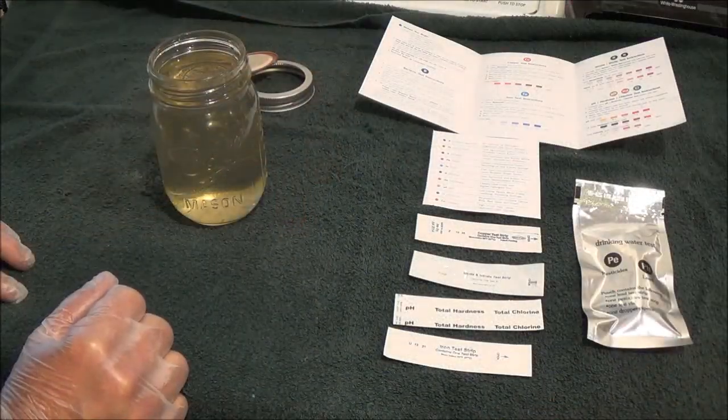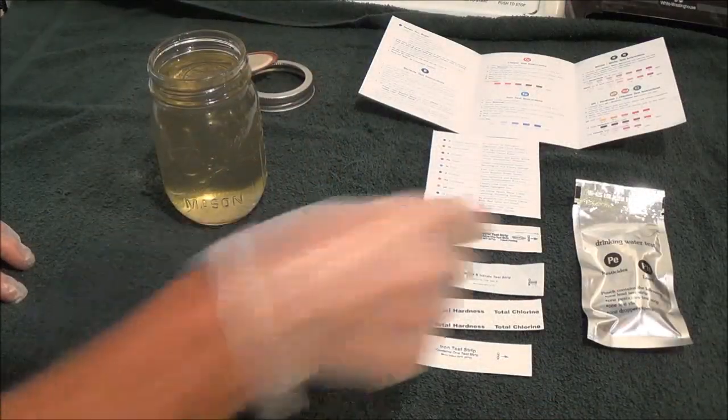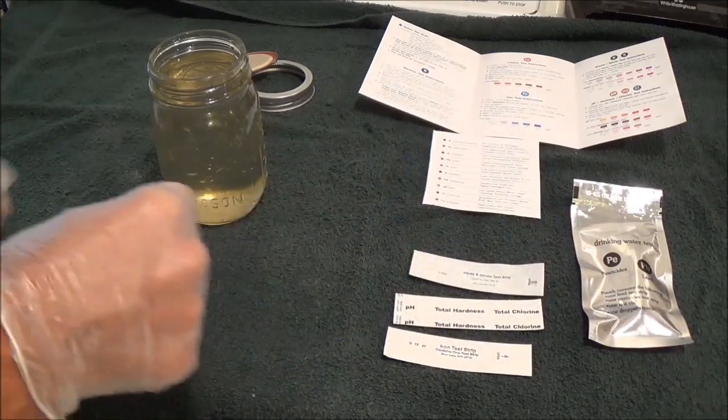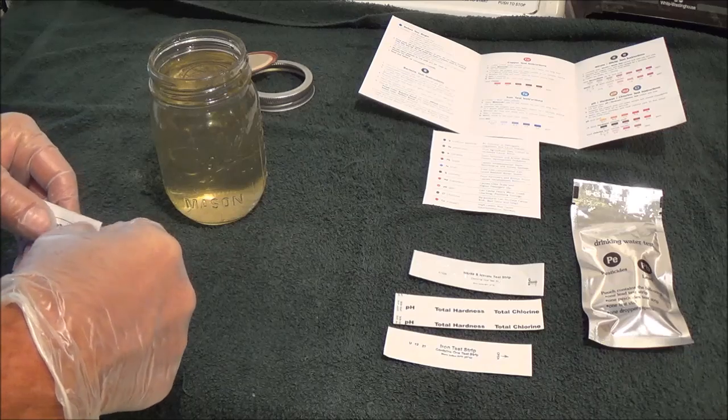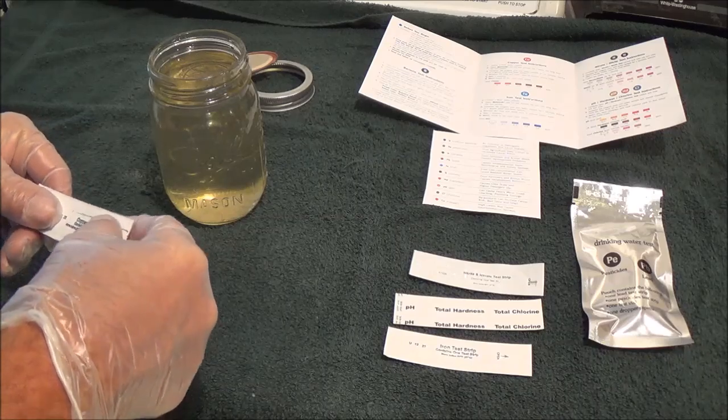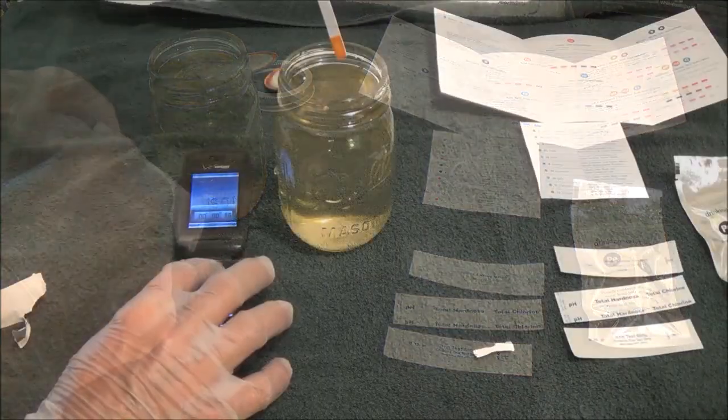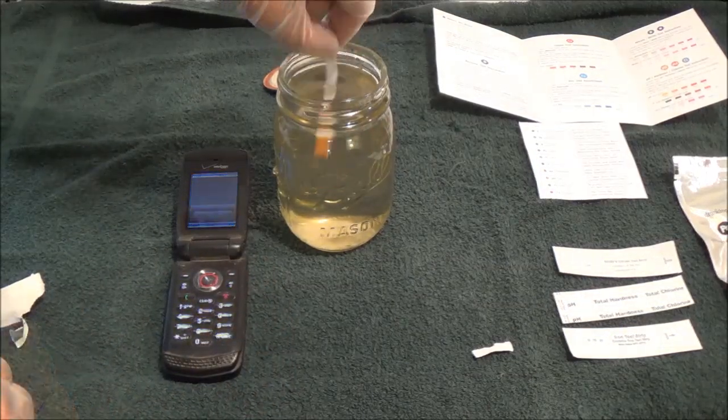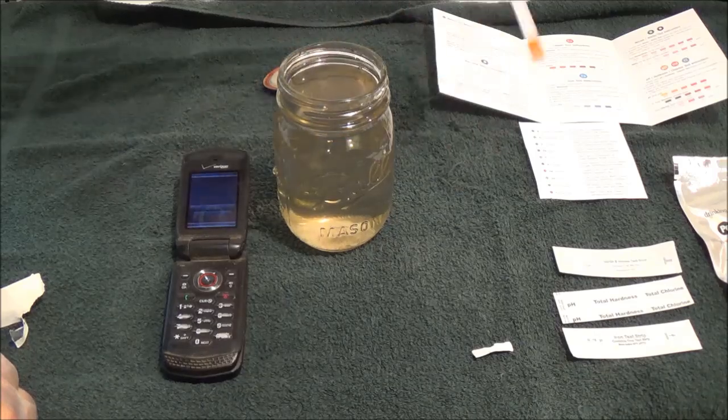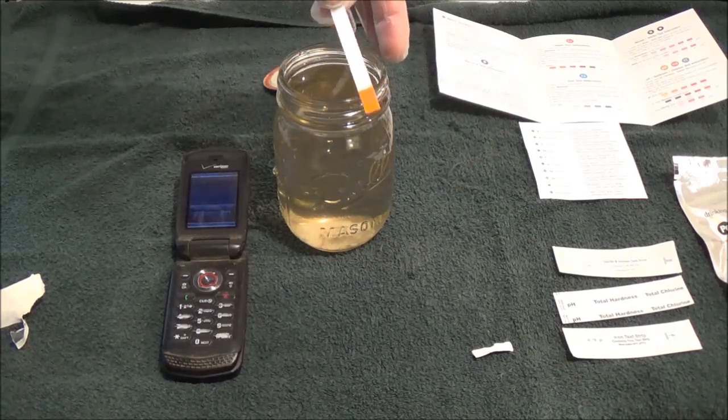Alright, the next one we're going to do is the copper test kit. Open the water safe test kit, remove the copper test strip, and immerse into the water for 30 seconds. Okay, that's 30 seconds. I'm supposed to shake it, and then we wait for two minutes.